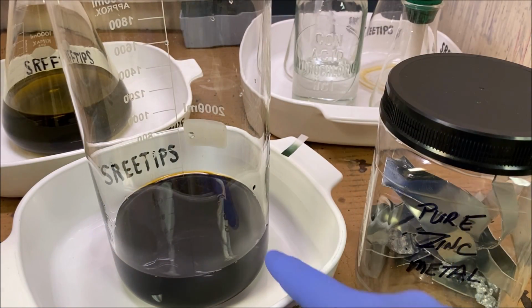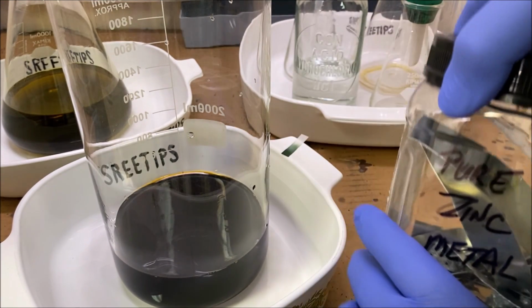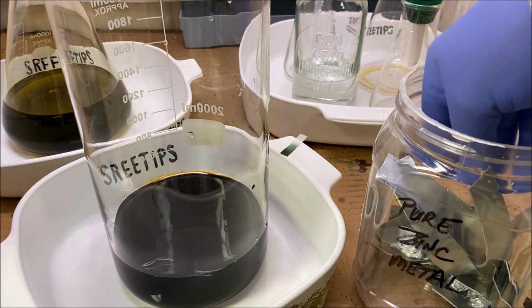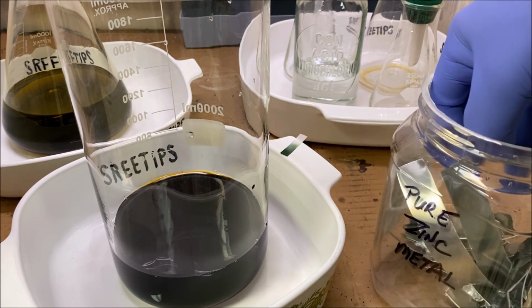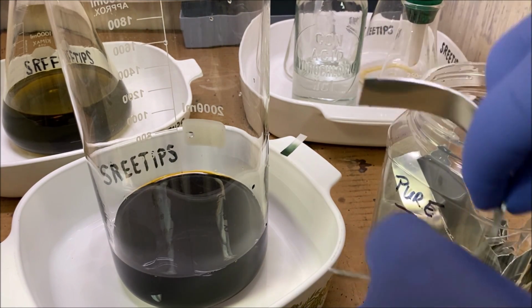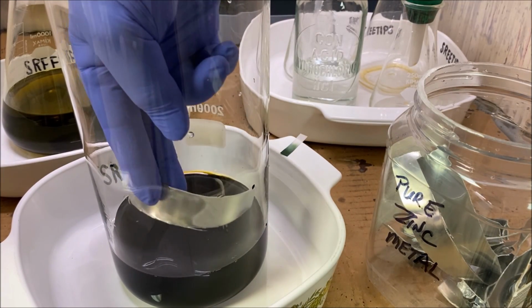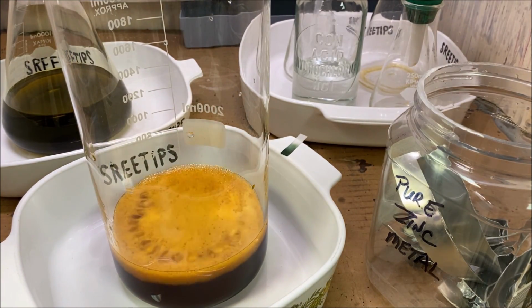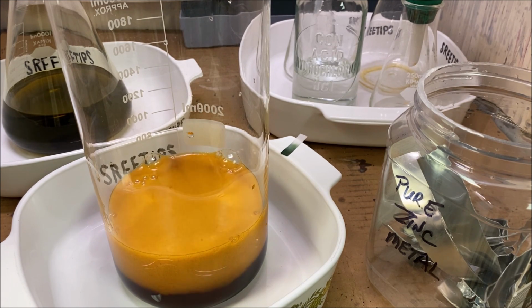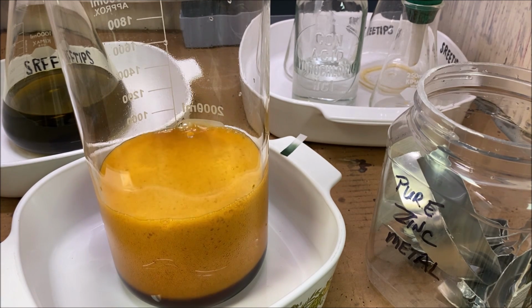Okay, I'm fairly certain that there's not going to be any gold in here. What I've got is some pure zinc metal, and now what we're going to try to do is use this pure zinc to cement the platinum group metals out of here. This should go fairly rapidly because it's a highly acidic solution. I've got it in a large beaker so that we can contain the potential to flare up like that.